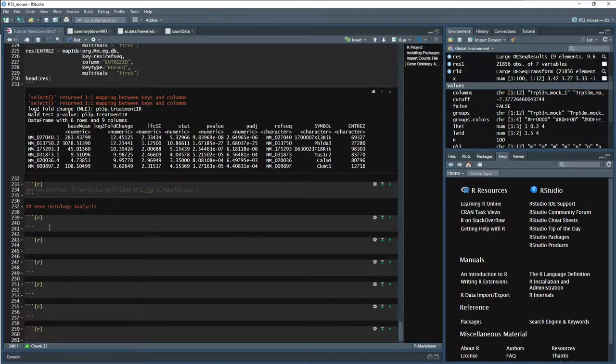All right. So now that we have our significant genes computed last time between the P53 irradiated and control versus the positive and minus P53, whether or not it's present or not, we can do something that's gene ontology enrichment. And so what is gene ontology? It's basically what category our genes belong to, or a more broad term for a group of genes. We can have a particular protein synthesis or a nucleic acid metabolism, like just a more broad term that will encompass more of our symbols or our entities.